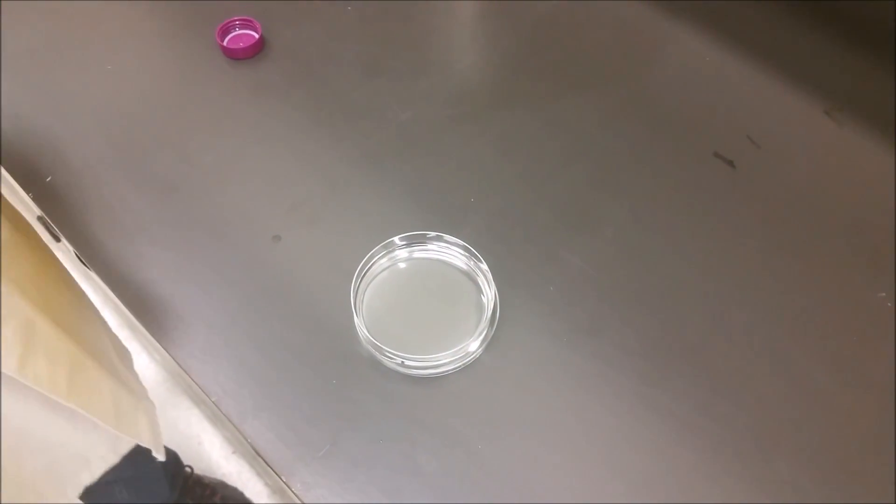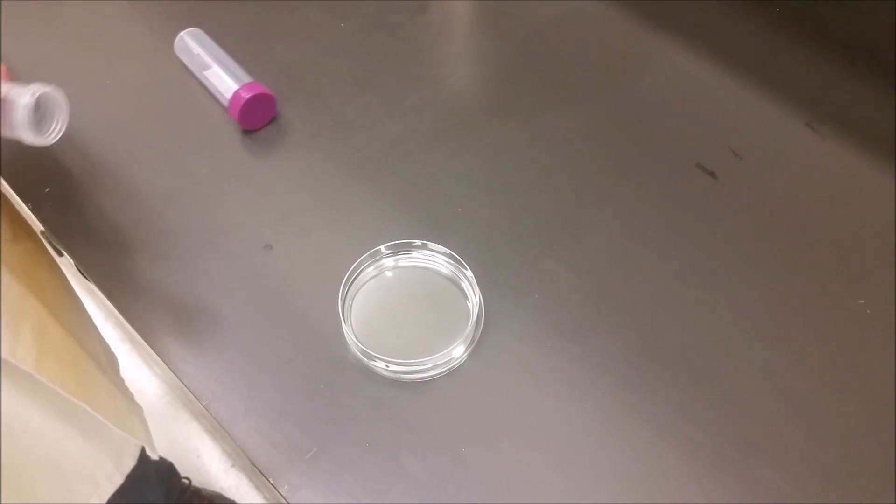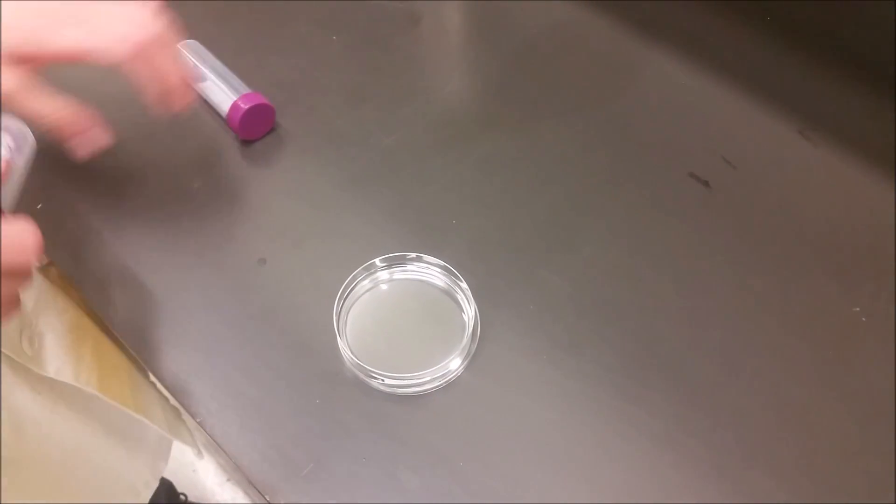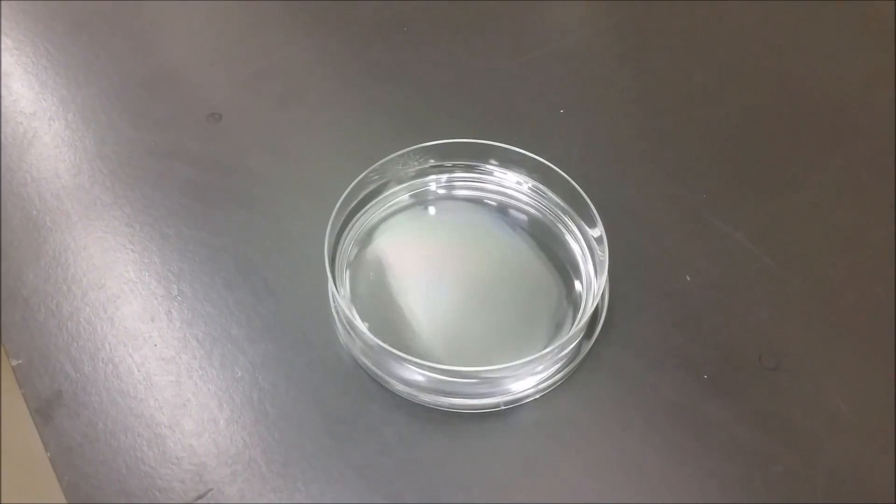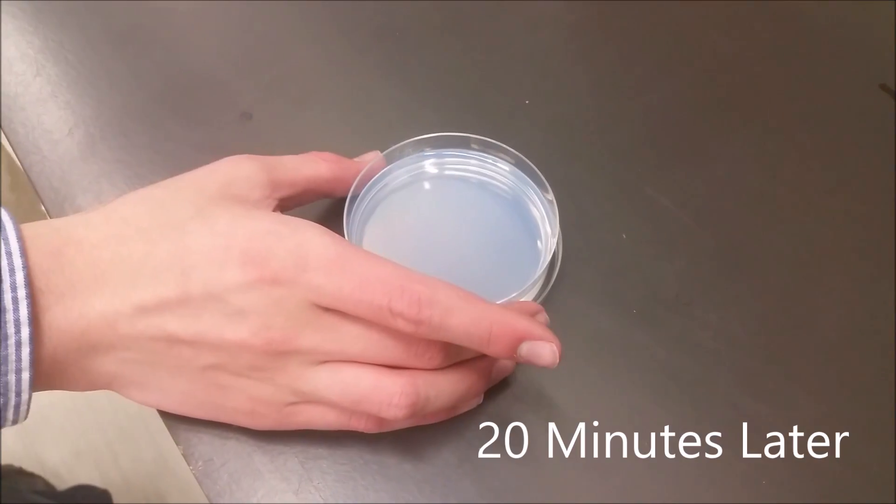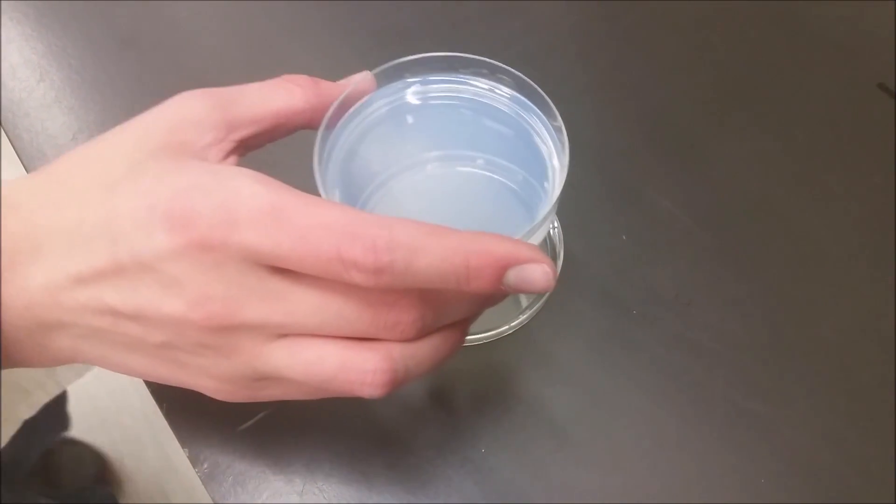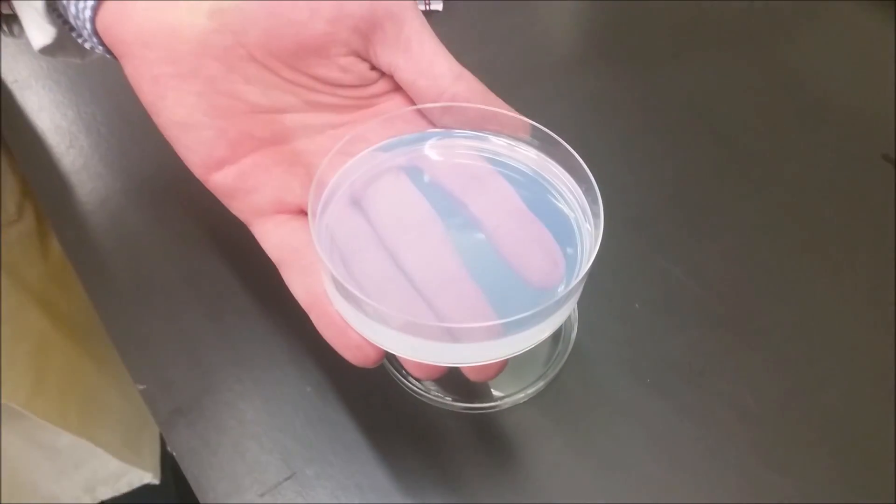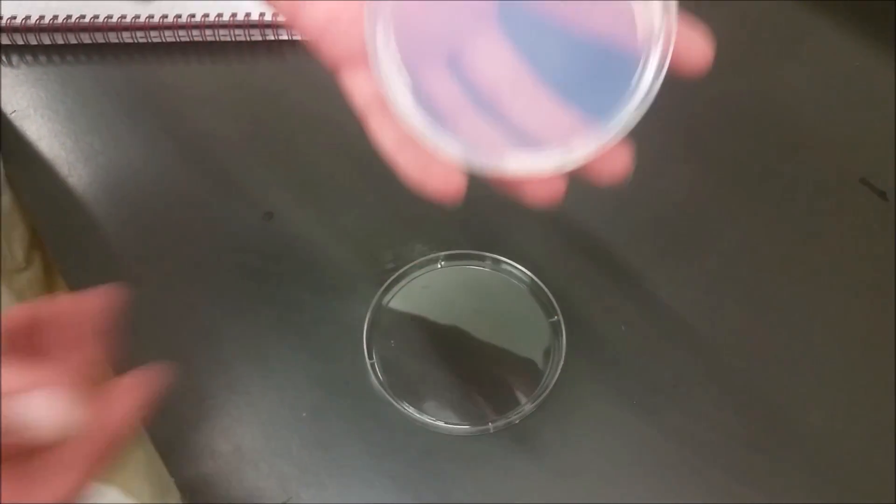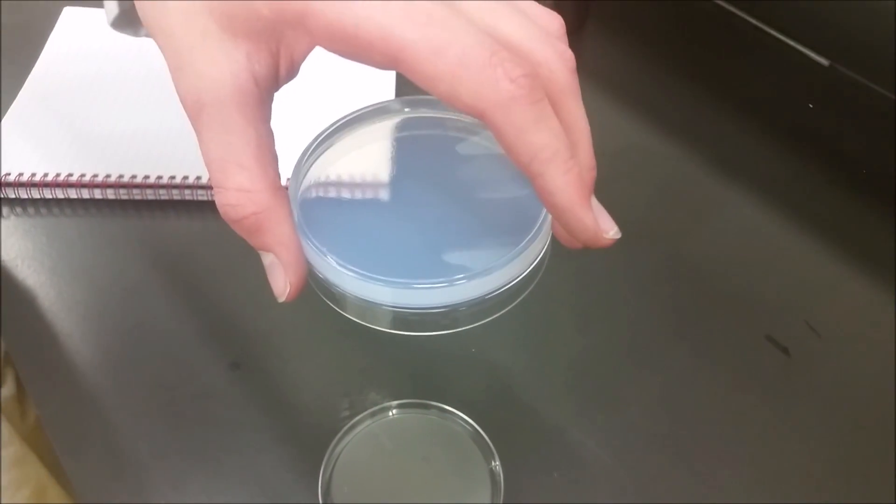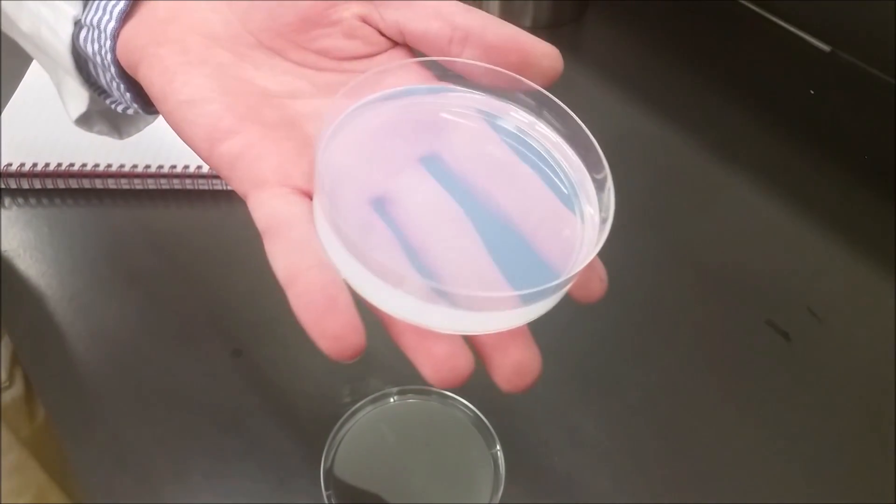If we're not lucky, it may take a few minutes and we'll come back to look at it. This gel is now finished, and to prove to you that it is no longer a liquid, I can actually turn it completely upside down and it stays in place.